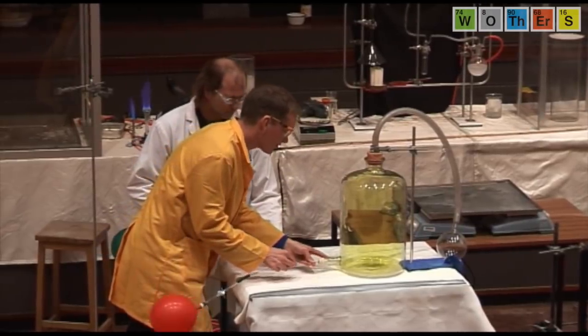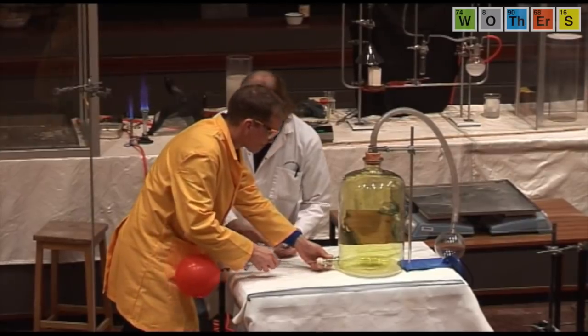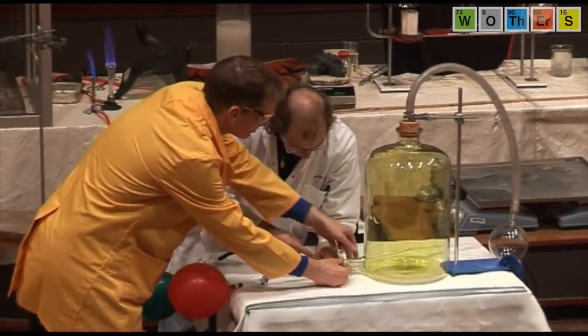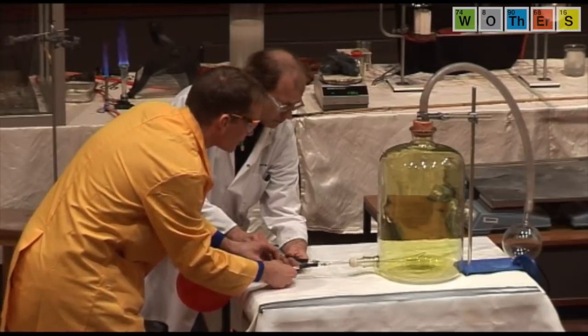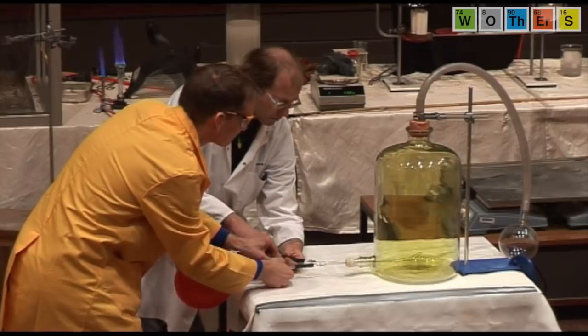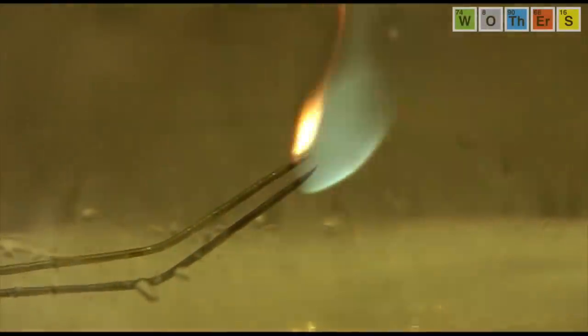So I'm going to put the hydrogen balloon into the chlorine. Chris is going to put the ethine or acetylene in. Okay, and I just need the nozzles to meet. That's good. So in a minute I'm going to open mine and Chris is going to open his. So if you open yours then, Chris. Oops. Try again. Okay, and yours off. There we are. So mine is now burning. Just leave yours there, that's fine.